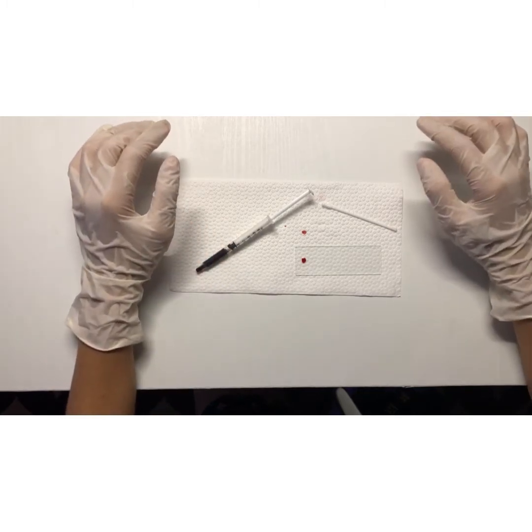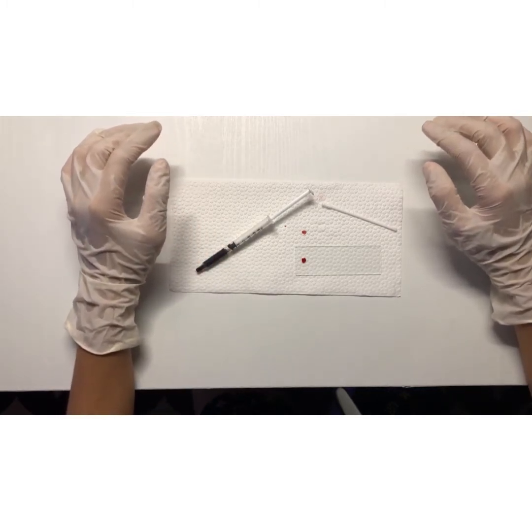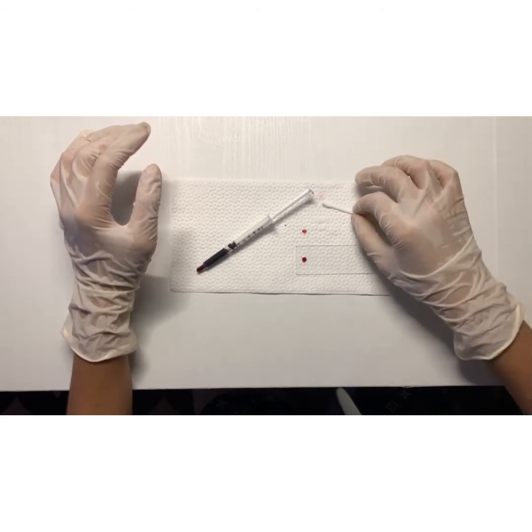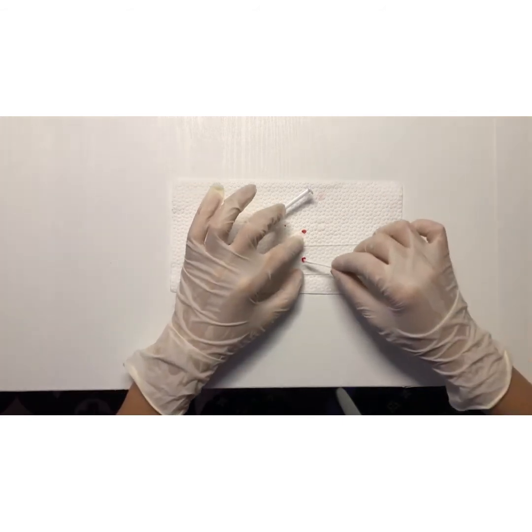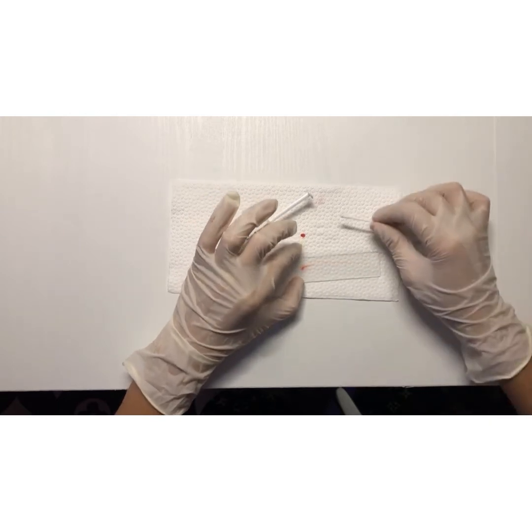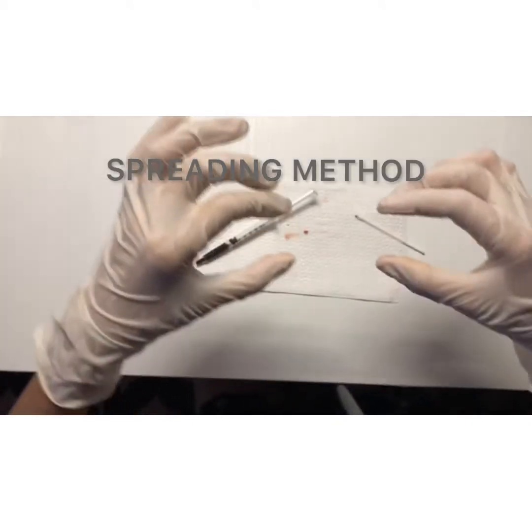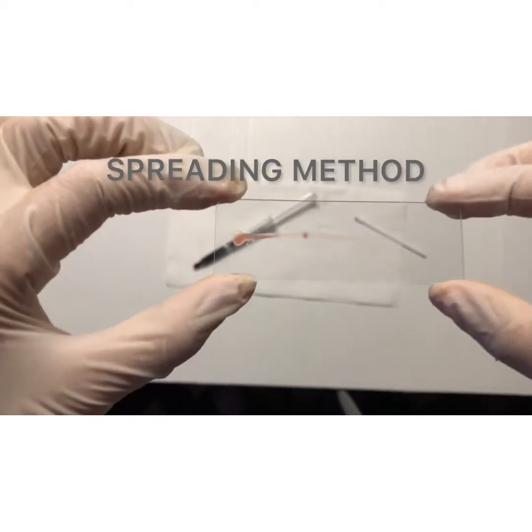Next, I will be spreading the specimen in a straight line up until the remaining length of the microscopic slide. So this is now spreading.